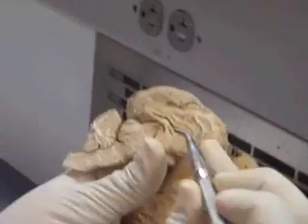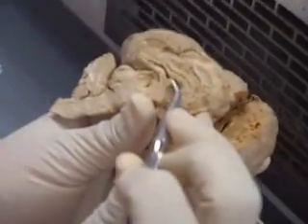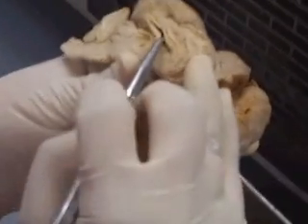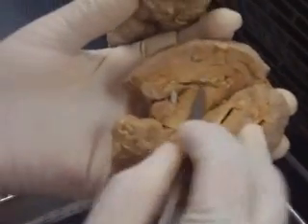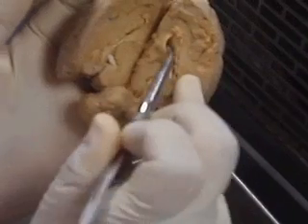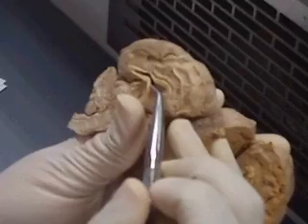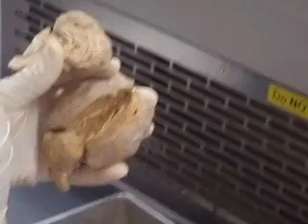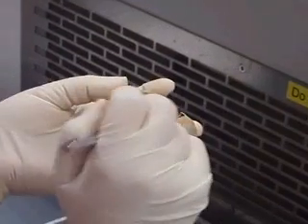The septum pellucidum is a tissue that runs along the midline. You see that there? This would fill this area too — it's a divider between this ventricle and that ventricle. So there's a ventricle here and a ventricle there, and there's a layer that divides them. You can see some of it still here, separating these two ventricles. Septum pellucidum lies between the two lateral ventricles.